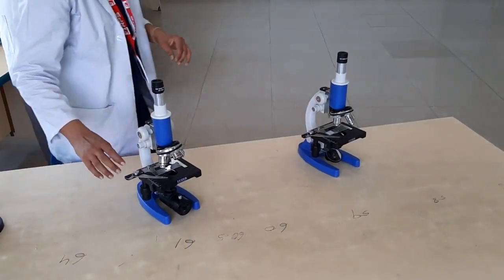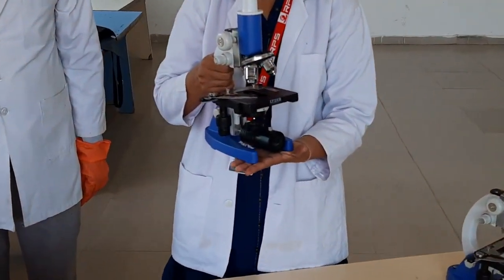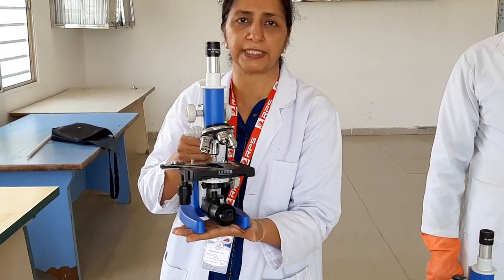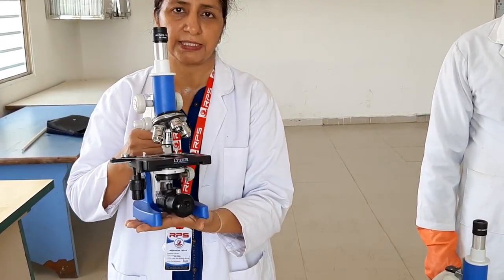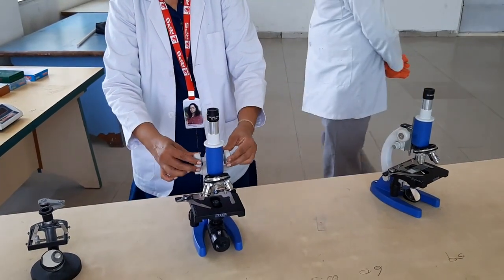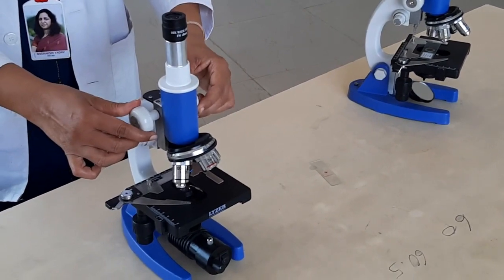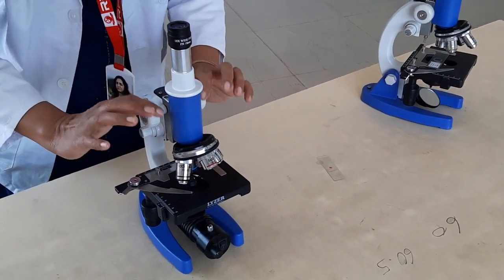Now let me tell you how to handle the microscope. Some students hold it incorrectly — that is completely wrong. You have to hold the microscope with one hand on the arm and the other supporting the base. The bigger knob moves the objective up and down; this is called the coarse adjustment, which is used for initial focusing.